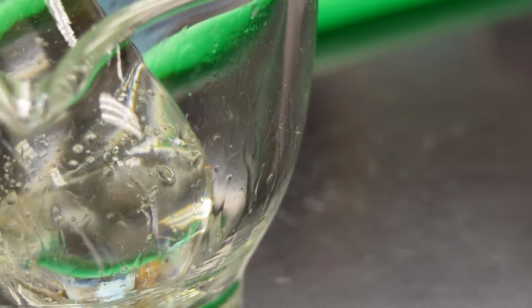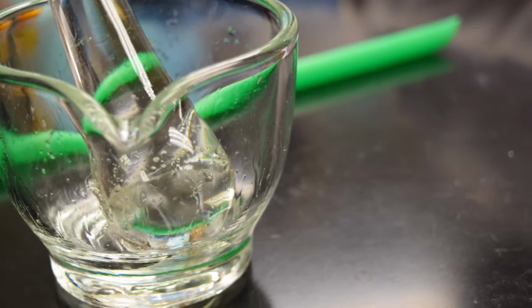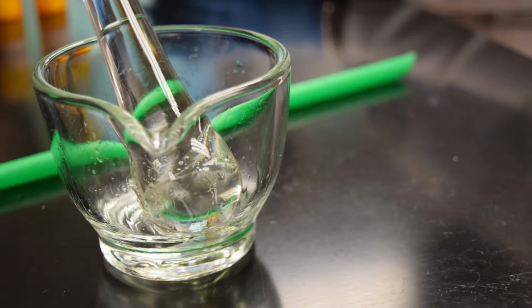In today's lab, we are going to use one of the basic pharmaceutical compounding tools, the mortar and pestle, which is kind of a symbol of pharmacy, right? Using the mortar and pestle and doing a very simple experiment, we're going to demonstrate how pharmaceutical compounding is done.